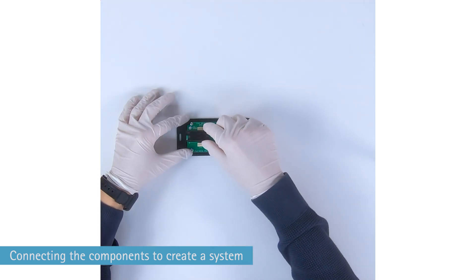We start connecting the pump driver. In this case we use the High Driver 4 as it is the most versatile one. Now, next the valve driver. Please note the right orientation, pin 1 to pin 1. Now the multiboard is set up in general.